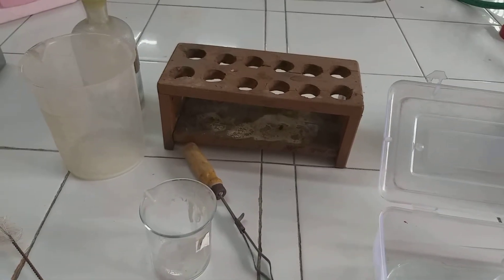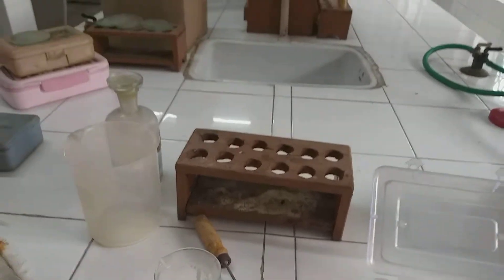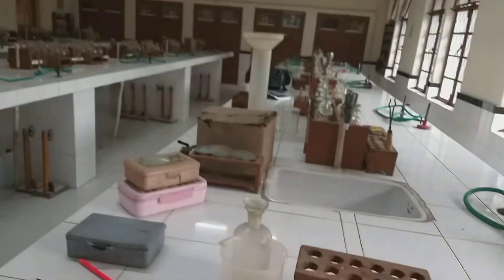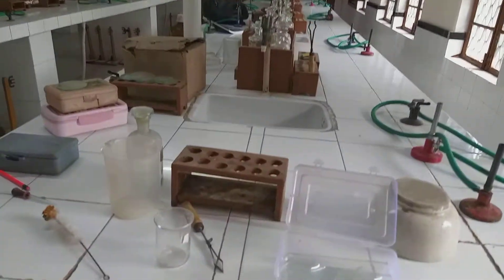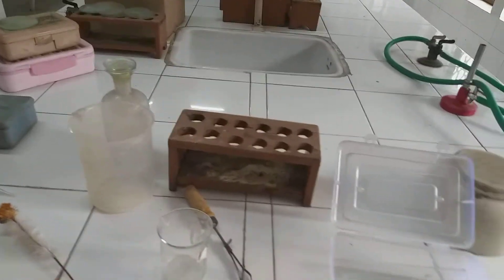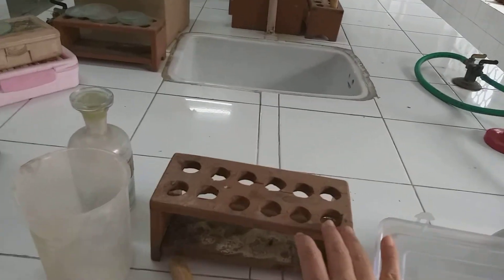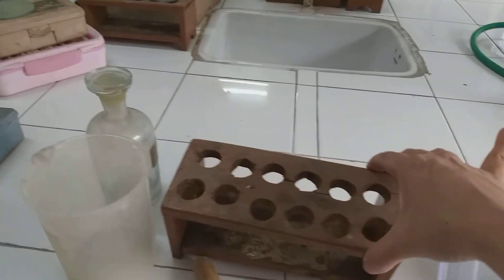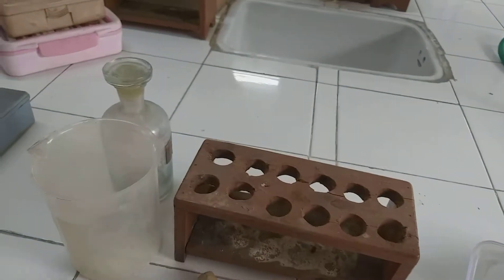Good morning students. Today I am showing you some very common apparatuses which are used in our chemistry laboratory. I begin with the test tube stand. This is a wooden stand — sometimes there are plastic stands also.